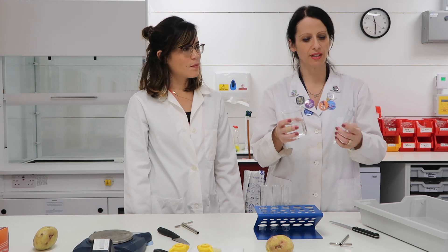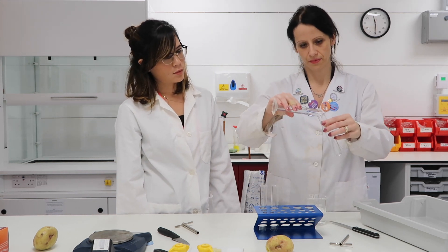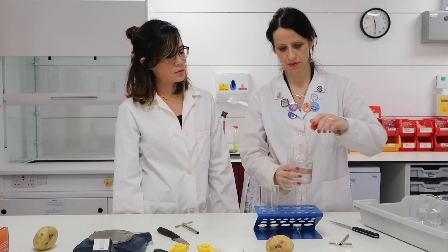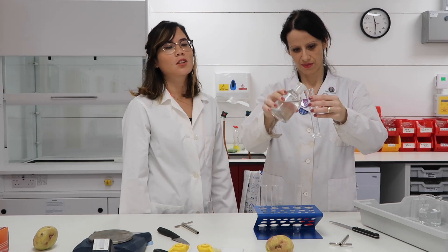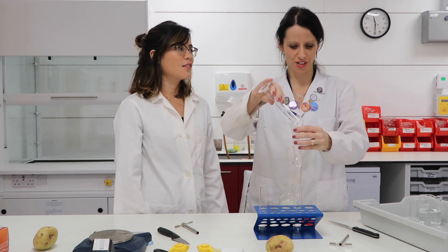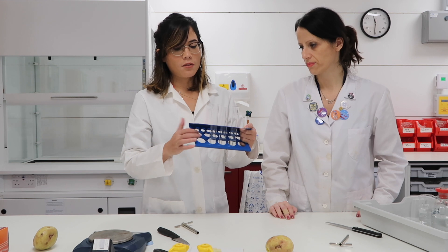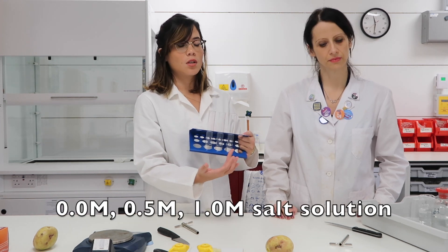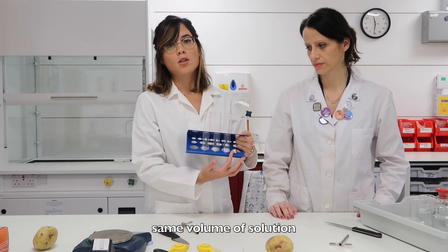We have three solutions. One is water, and I'm going to use the cylinder to measure it. Then I have 0.5 molar sodium chloride. Notice Emilia is not wearing safety goggles — it's because we're just using salt solutions, it's not dangerous. So we have our independent variable, the different concentrations of solution: one is pure water, one is 0.5 molar salt solution, one is 1 molar. Notice we have the same volume for each — that's another control variable: 20 centimetres cubed. You also need the same temperature. We're now ready to begin the experiment.